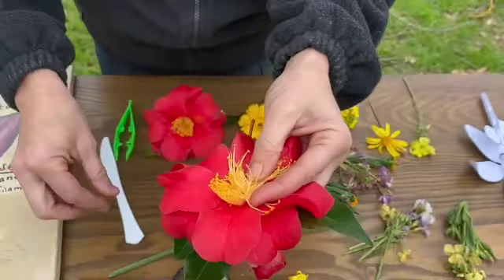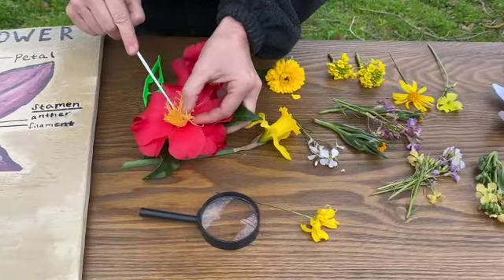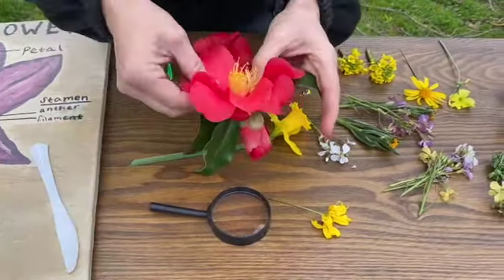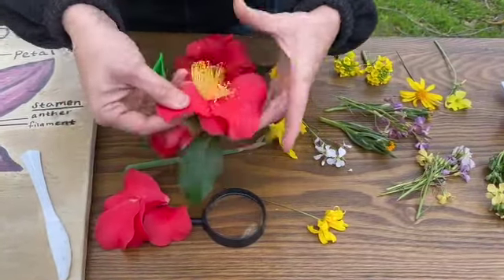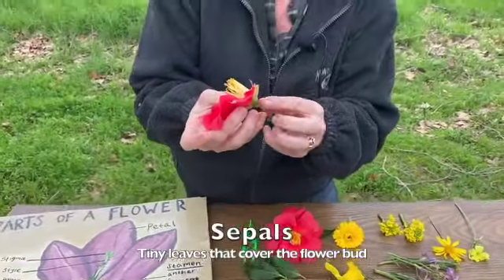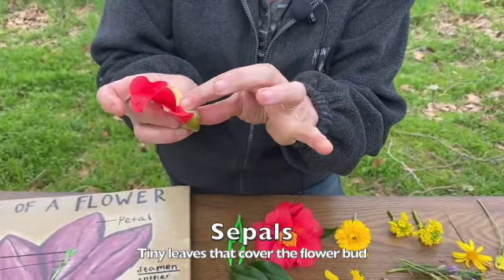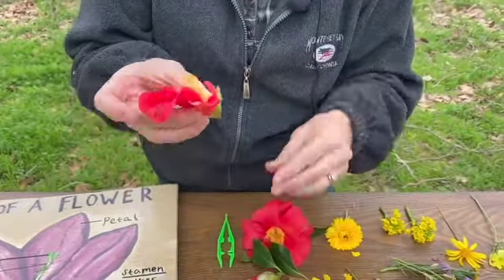So if we were going to do a dissection, we might want to try to cut away a few of those pieces. But I think first I'm going to pull some of the petals out of the way. Okay, so we're going to pull those to the side so we can see this middle part. Oh, there are the cool things that are called the sepals. Those are like the little leaves that would have had the bud wrapped up at first. Now we can really see them apart from the main leaves.